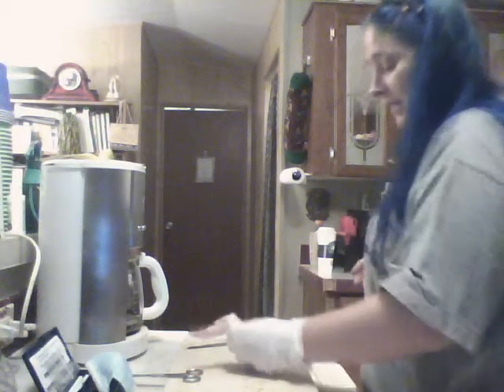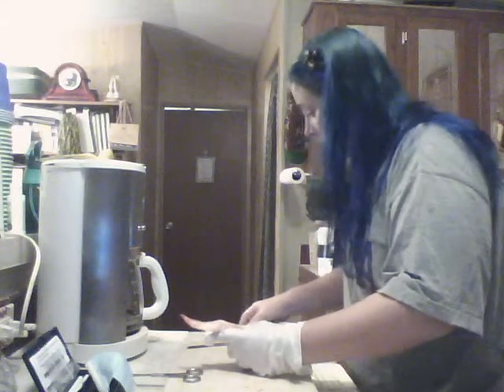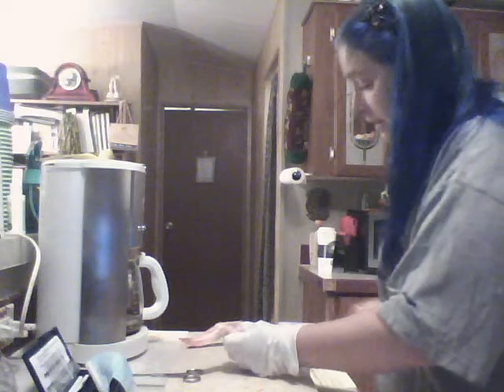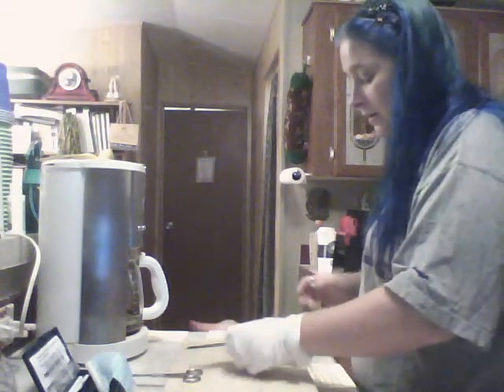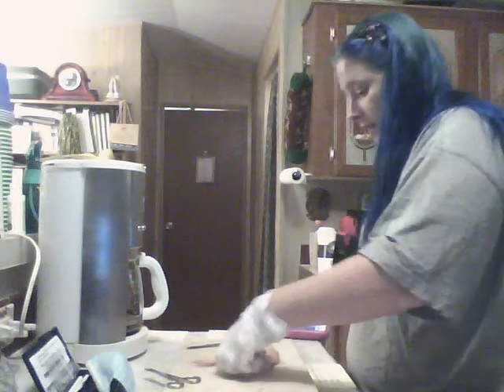So this one here has got to be the extensor muscles. So pull it, it straightens up.